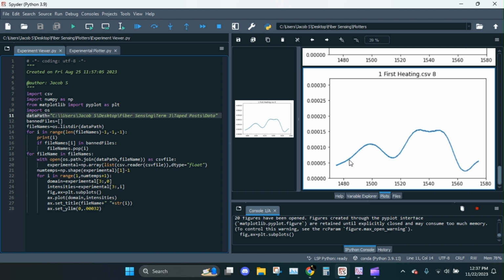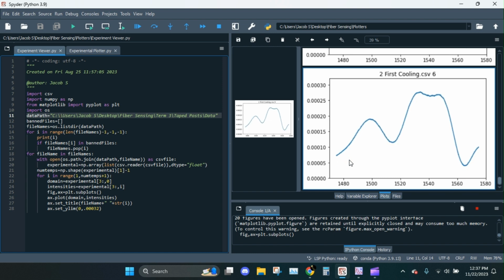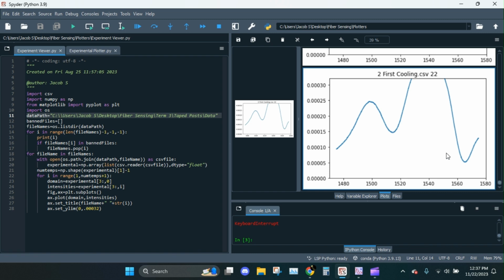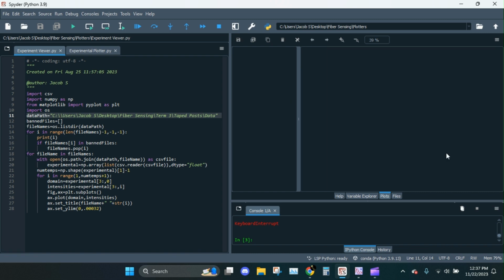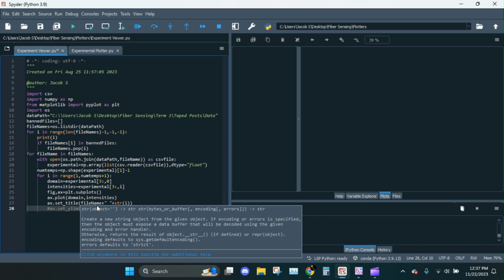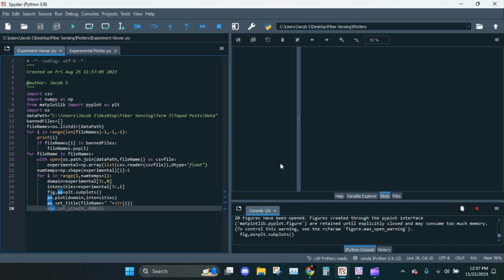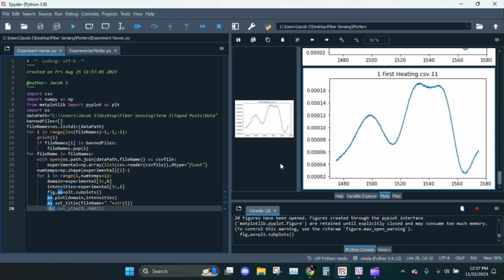See, you have to. Oh, there we go. See, first cooling. Oh, I forgot to fix the thing. Hold on. Oh, remember last time you saw data going out of bounds? That's because I have a fixed Y limit here. Which is handy sometimes, but for now I'm just going to comment that out. Now I should be able to see the whole thing every time. Now here we go.